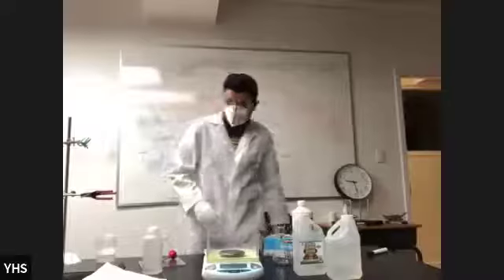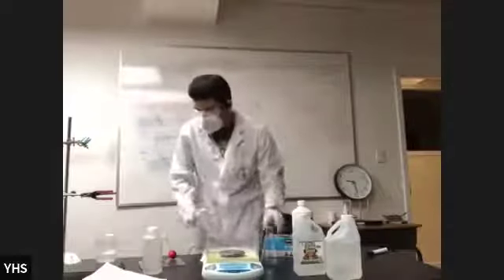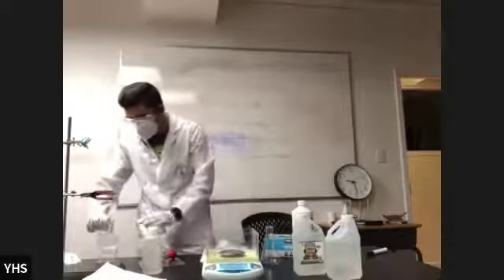Let's clean up my area. Okay, what is the next step? What does the next part of the procedure say?